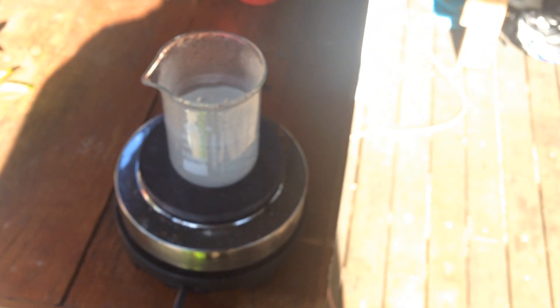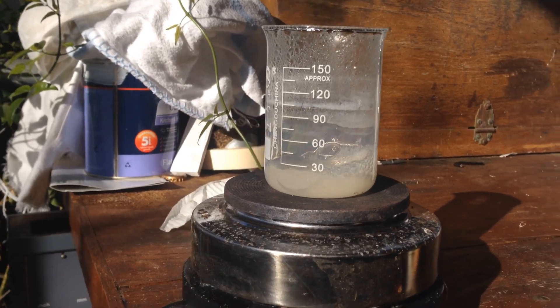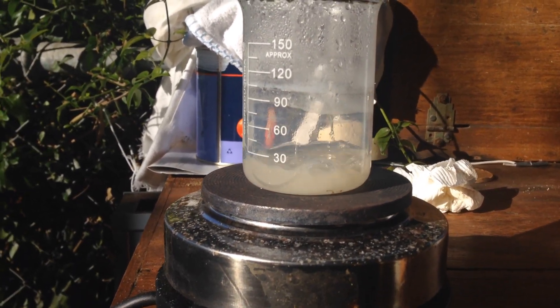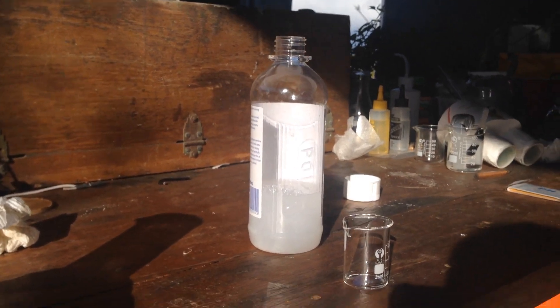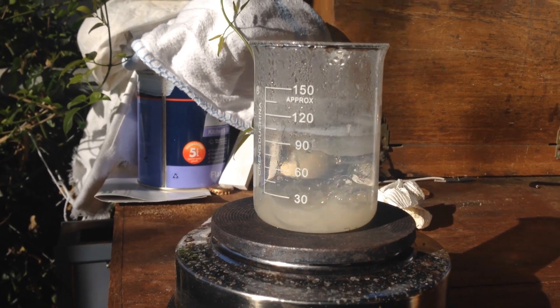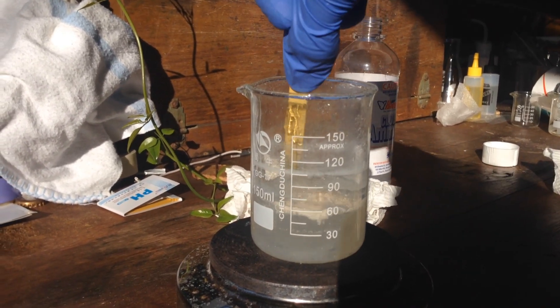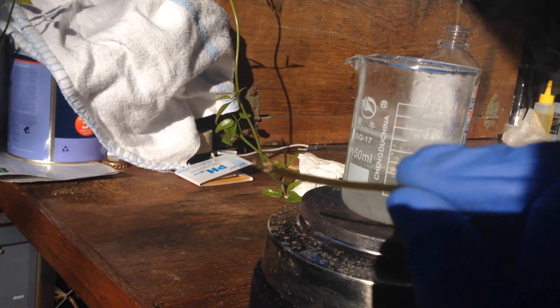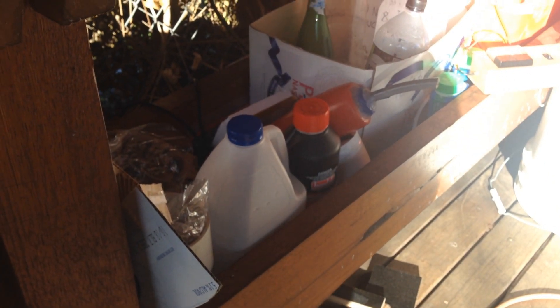However, if this is still acidic by the end, we'll see if we can add a little bit more ammonia to try to neutralise it again. It took ages, but we've concentrated that solution down to around 20 milliliters, and I've just checked the pH and it's still really quite acidic. So I'm going to need to add a little bit more ammonia, but maybe we'll concentrate it down further just a little bit more. So I just added around 45 milliliters of ammonia, and finally, if we dip in this piece of pH paper, you can see we have actually reached a pH neutral. So if you try this, make sure to get your stoichiometry right, because it's very annoying to try to balance it out if you've got twice the amount of hydrochloric acid than you actually needed.